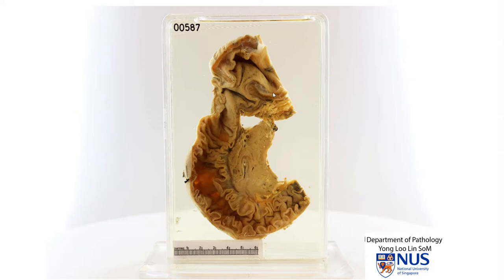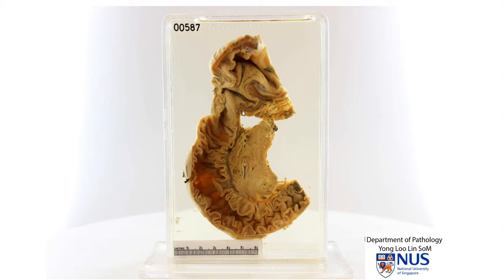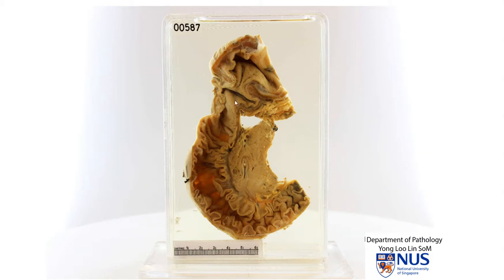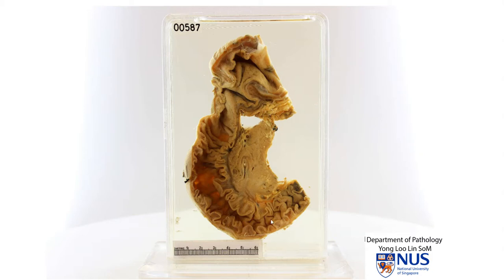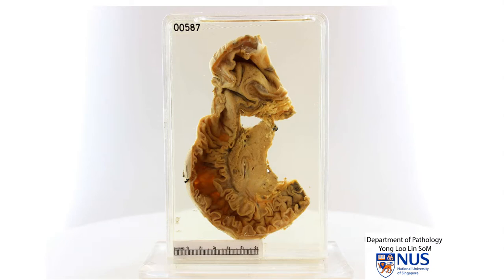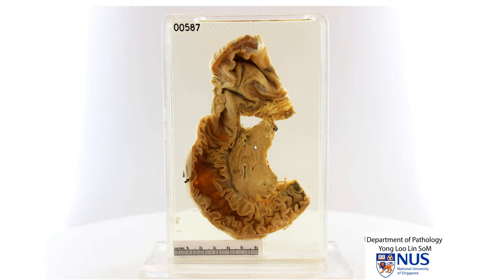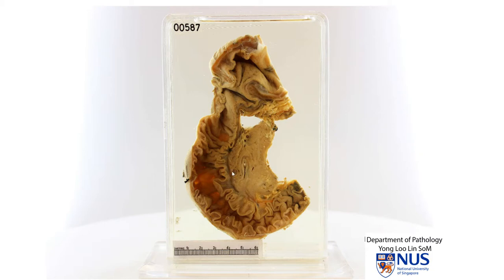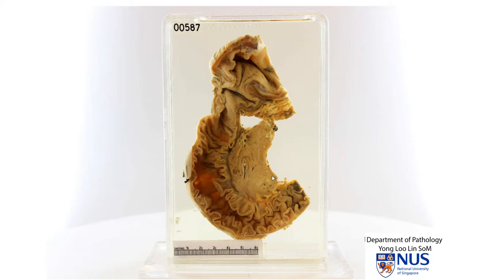So in summary, this is a Whipple's resection specimen, which comprises the distal stomach, the duodenum, and the head of the pancreas. And we see here an ill-defined tumor in the head of the pancreas, and this is a ductal adenocarcinoma.